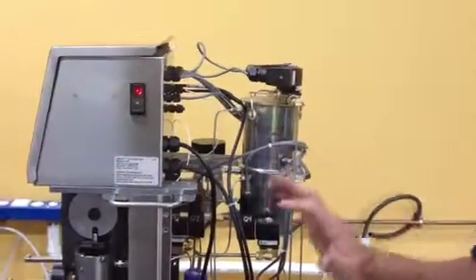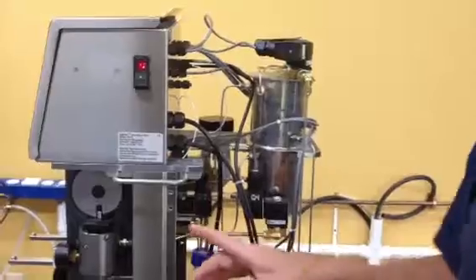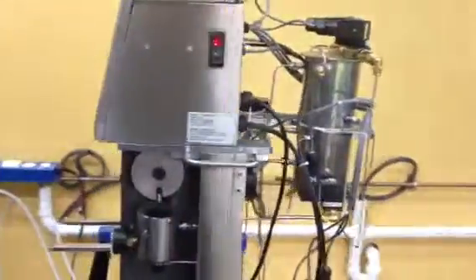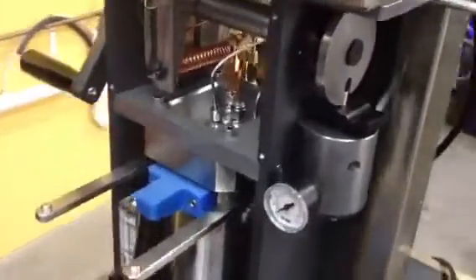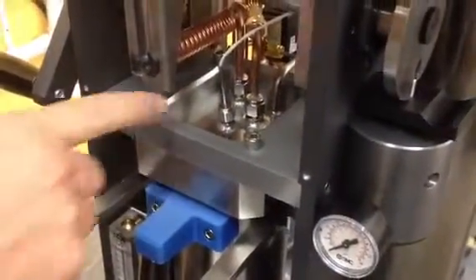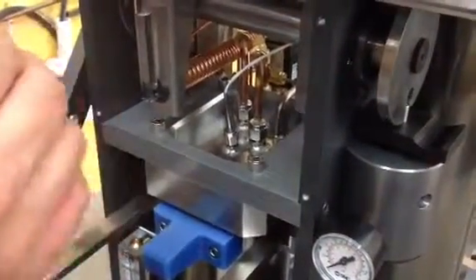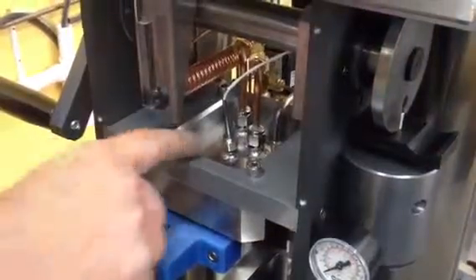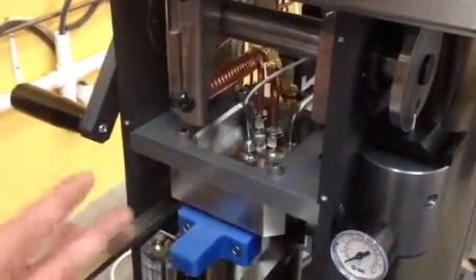And the leaking points that you might find, the first one that I'd like you to check is the front probe here. This is the temperature probe. This is what gets your readings for your temperature on your display. Make sure this is tight. There's a Teflon ferrule in there, so it might feel a little loose. Just take a wrench and go clockwise with this fitting right here, making sure that it's tight.